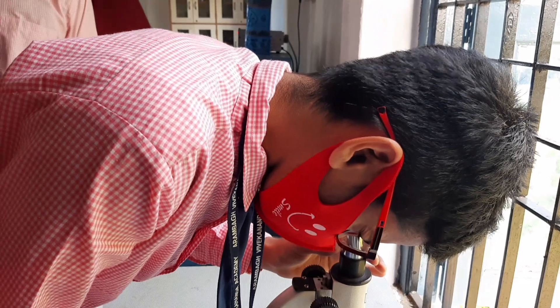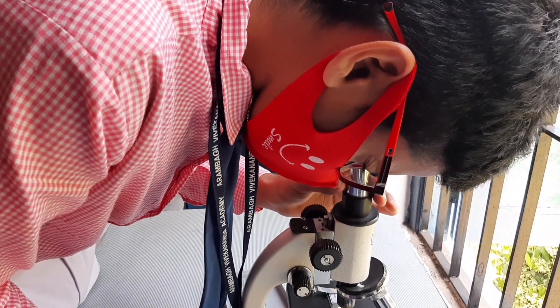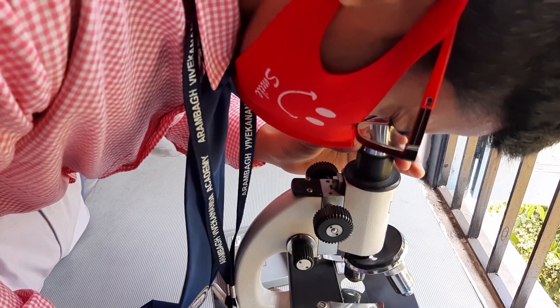The next type of plant tissue that we are going to study is colenchyma. Here I'm fixing the colenchyma tissue slide, and then we are going to see what type of tissue is colenchyma.